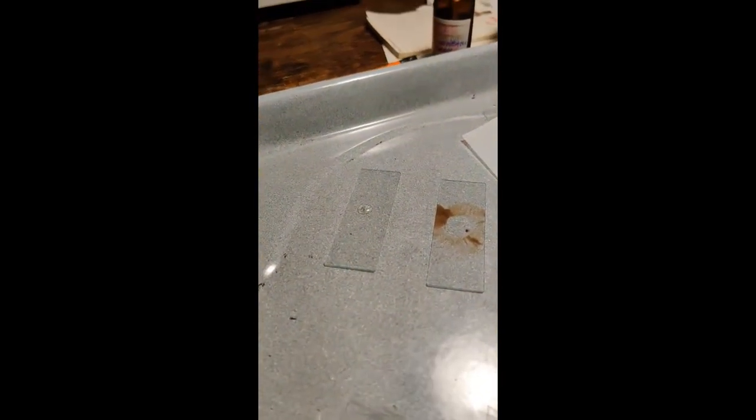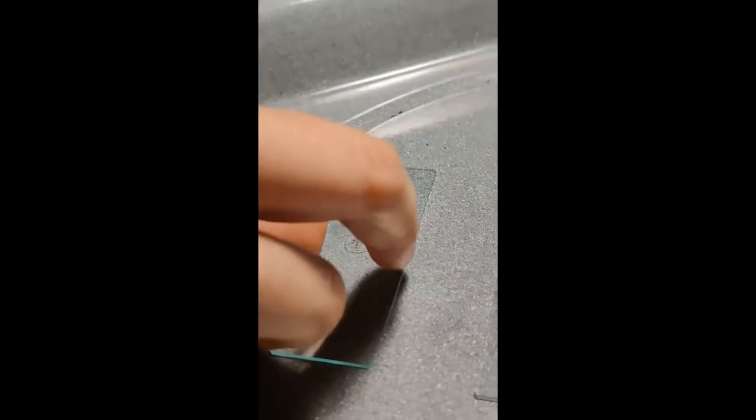They look a little dirty so I'm going to clean it with my shirt a little. It's probably fine. And then I place it on here.